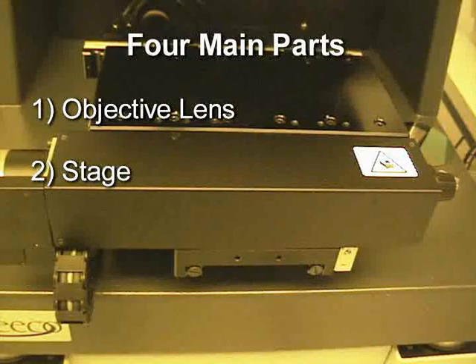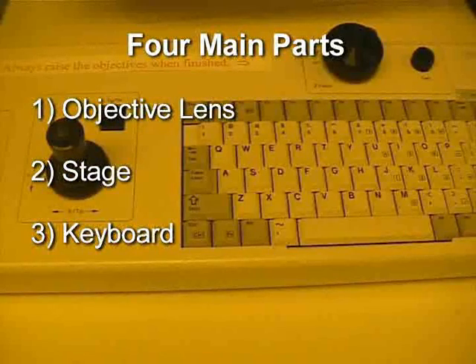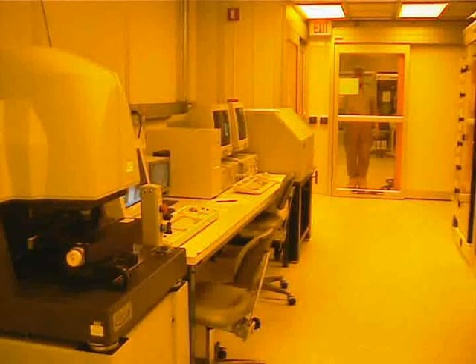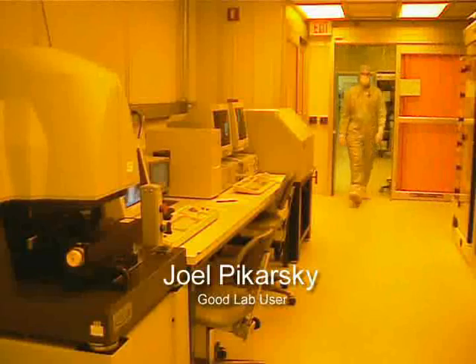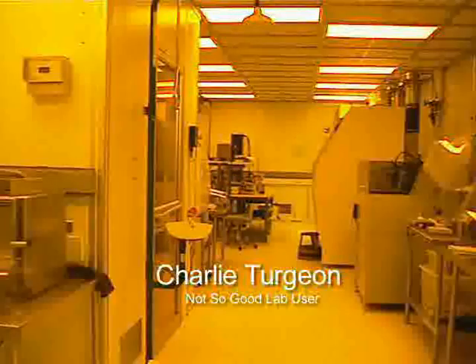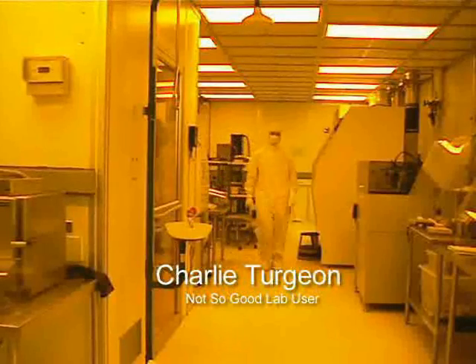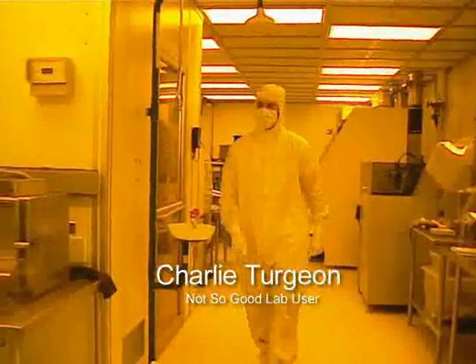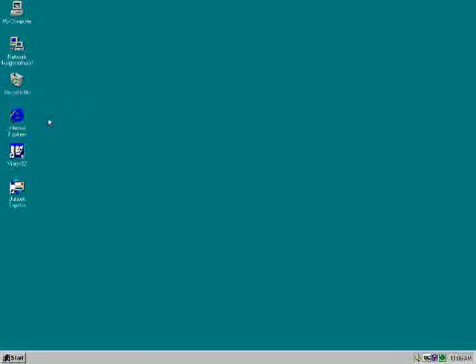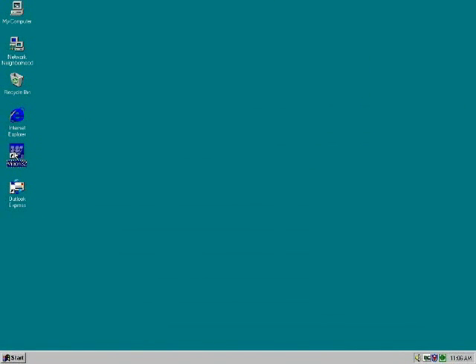Before we can do anything, we must first start the software. As you might notice, the illumination is turned on as soon as the software has started.